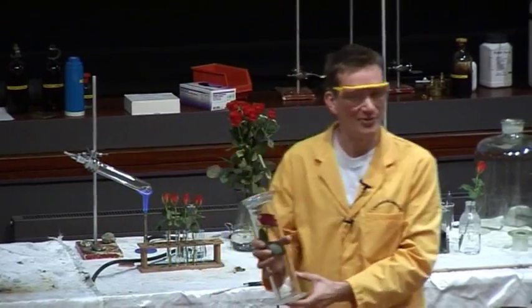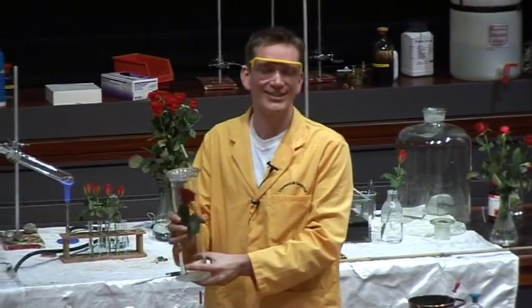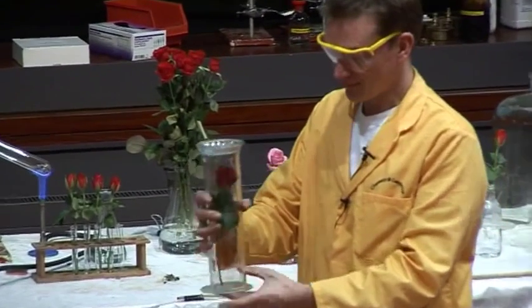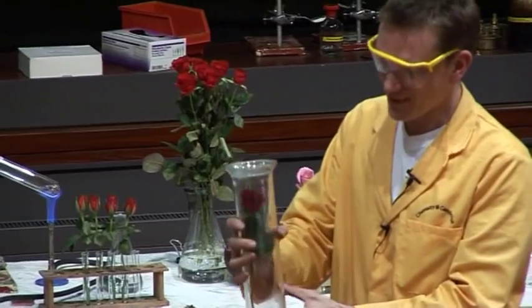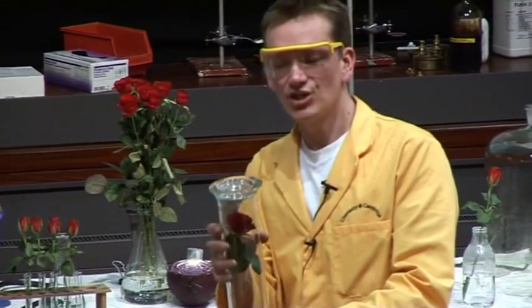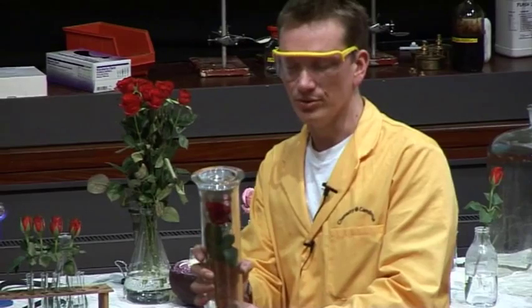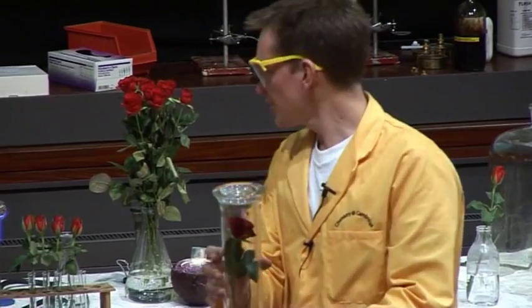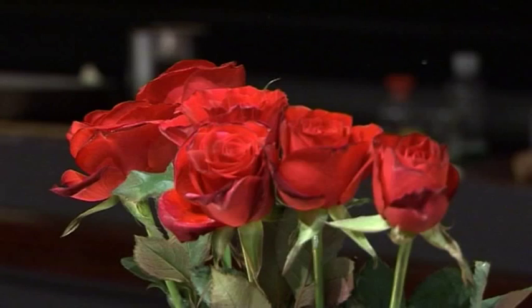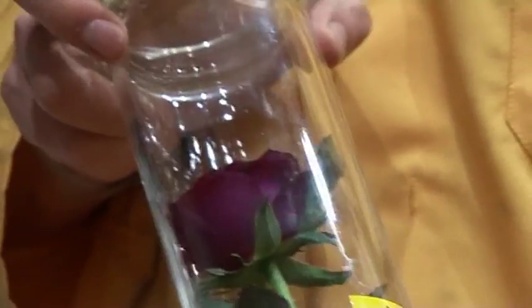I've got a whiff of ammonia there. I don't know how it's going around if you're smelling this and experiencing it, but I've got a good whiff. Anyway, the ammonia here is actually beginning to change the colour of the rose. You may see that it started off a really bright red, and already it's going sort of a blackish colour.